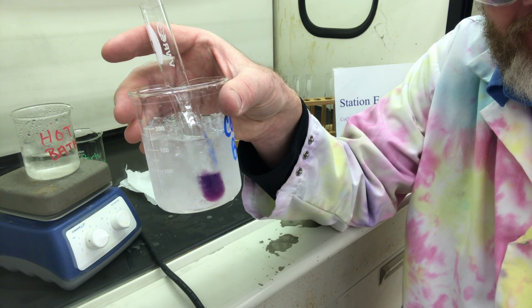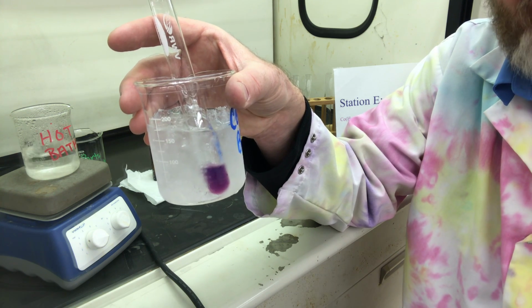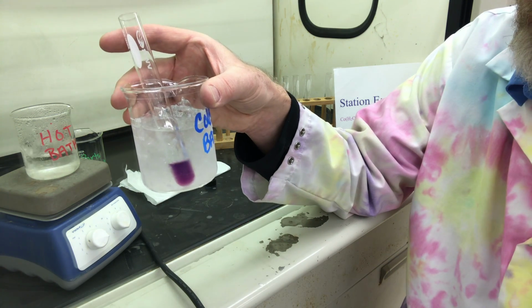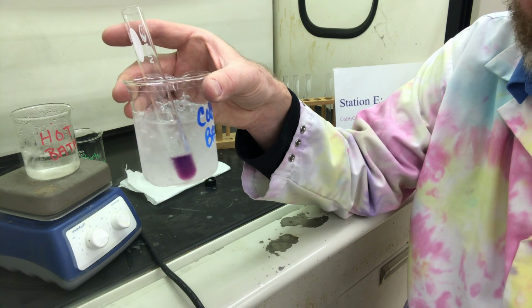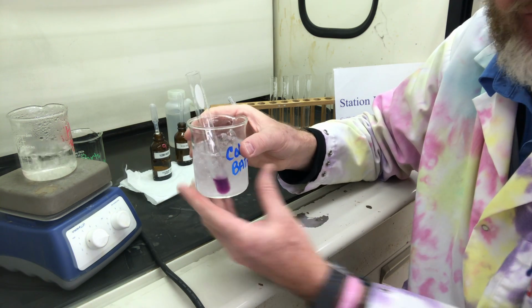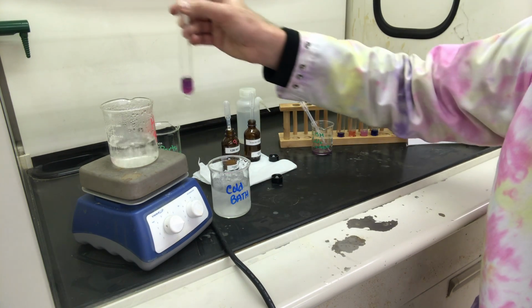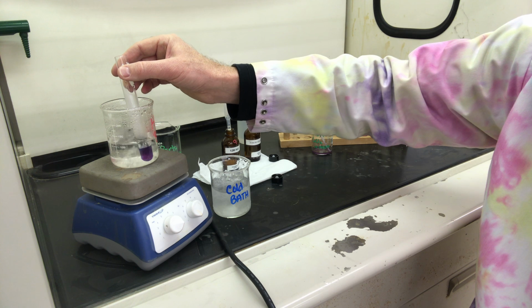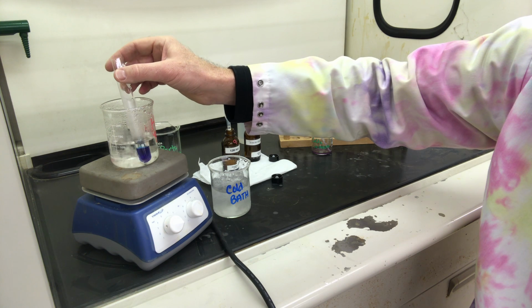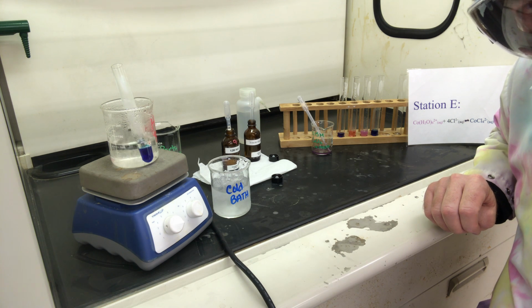We'll see if we can tell any changes, although sometimes it's gradual, and it's hard to see these changes as they slowly cool or slowly heat up. So now it's pretty cold. Let's see if we immediately transfer it to our hot water bath, if we can see a change that occurs. Let me turn this around a little bit. So here's our cold. We're going to go to hot. Can you see that color change?